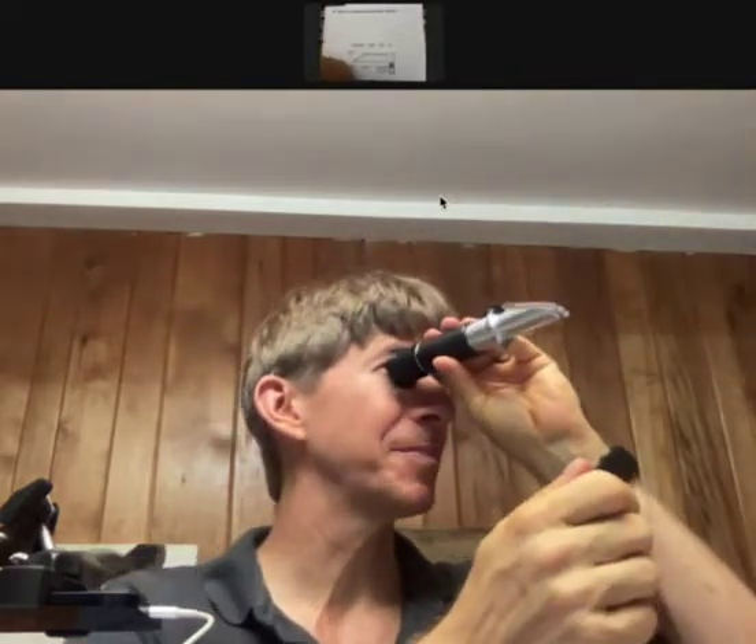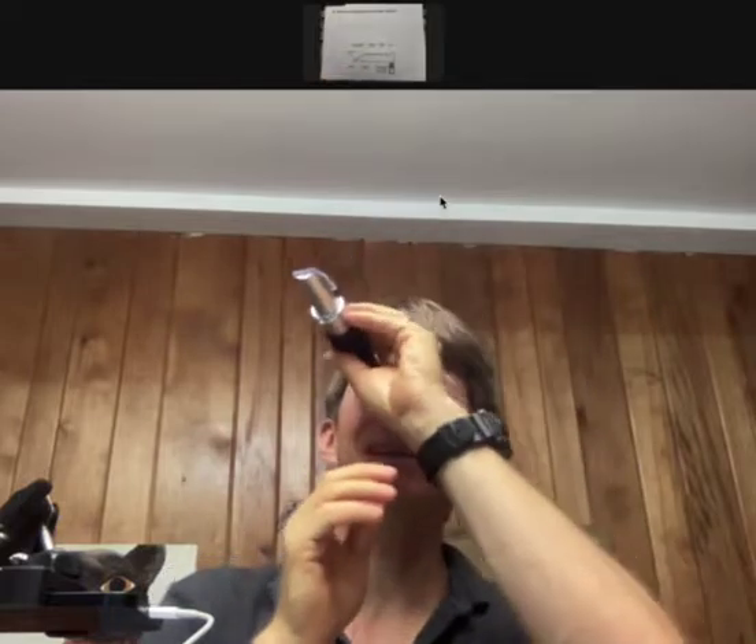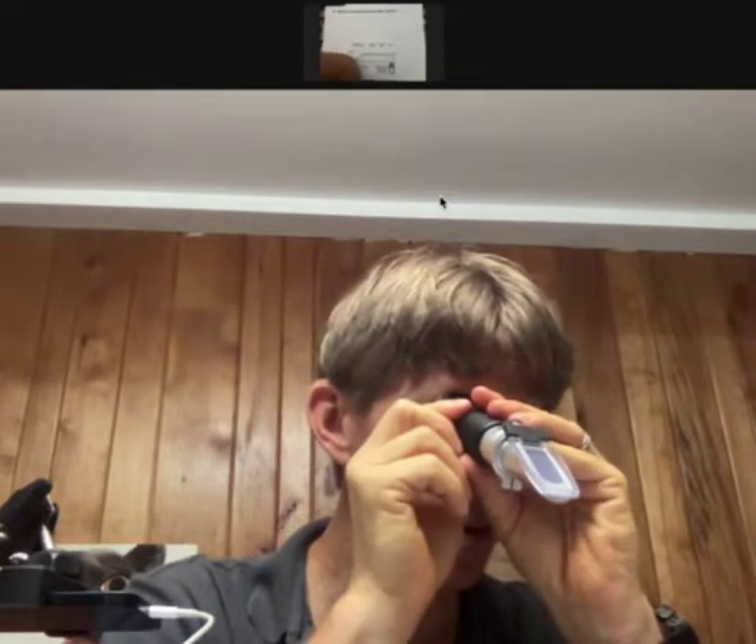If you have one or two small air bubbles, I've actually found that your measurements come out just fine. Then you're going to hold it up to your eye and aim it towards some sort of light. Outside light works well. I have a light right here that I'm aiming it towards. And what you should see is a light to dark transition with light on the bottom.